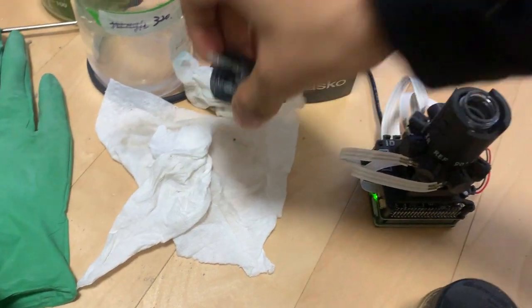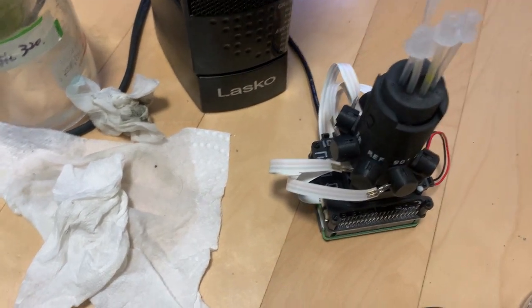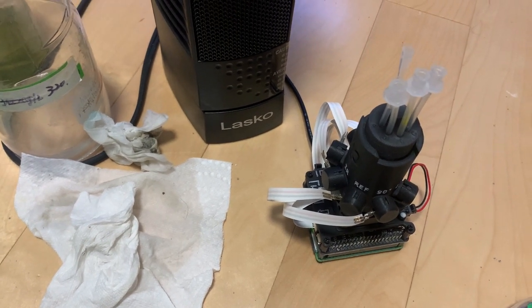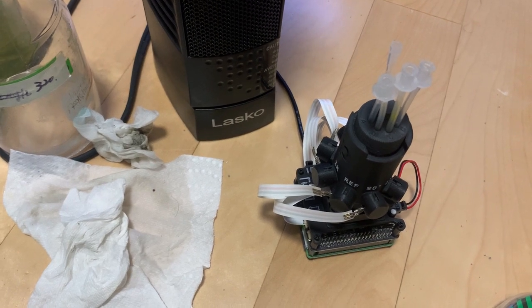Oh, the cap fell off. Drop that in there. And it will now sit for the next 12 hours, and that modified clay will absorb all the algae, pull it to the bottom of the vial, and leave it completely clear, which we'll see on the graph, like I said, in 12 hours.